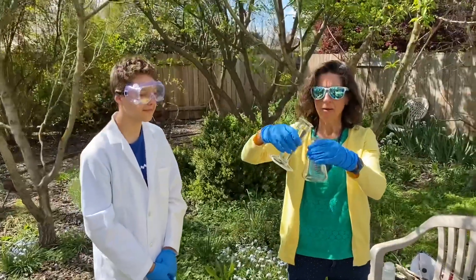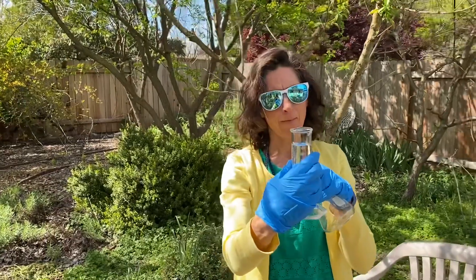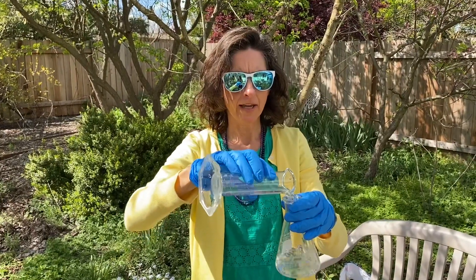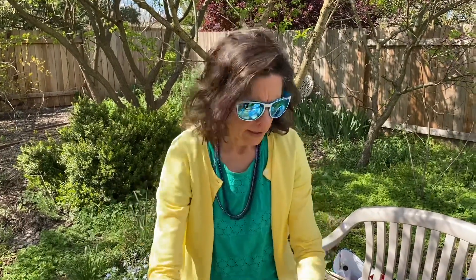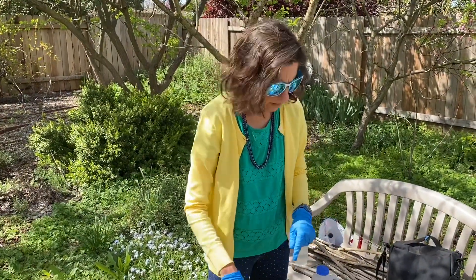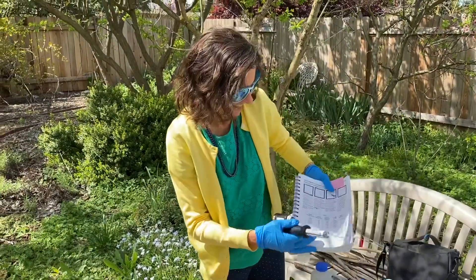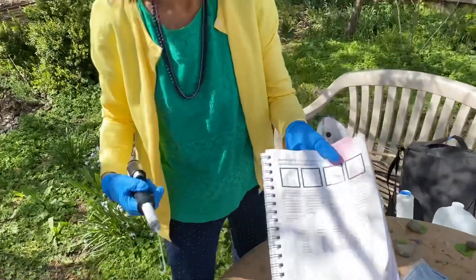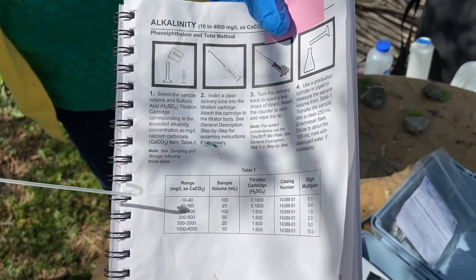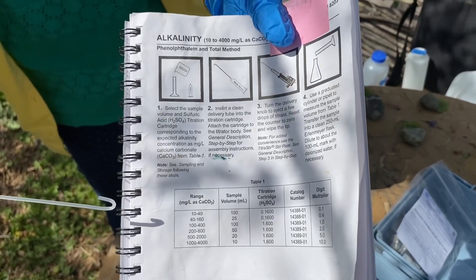I've got 100 milliliters of Davis tap water, and I'm going to put it into my flask. The way I knew how much to add — there's a little table here in the book, and you estimate where your value is going to be, and you use that to decide what concentration of acid to use and what volume to use.